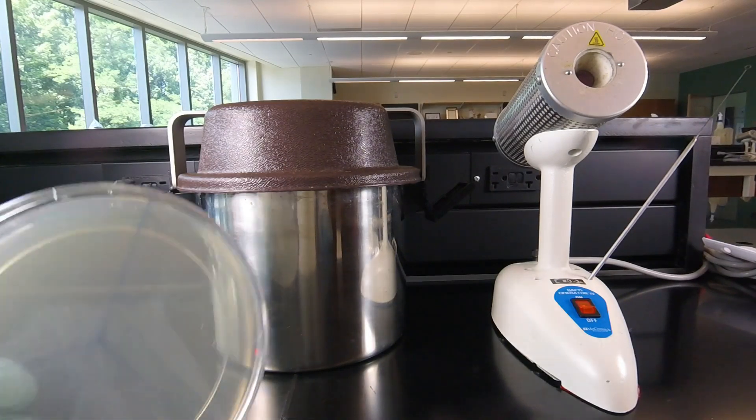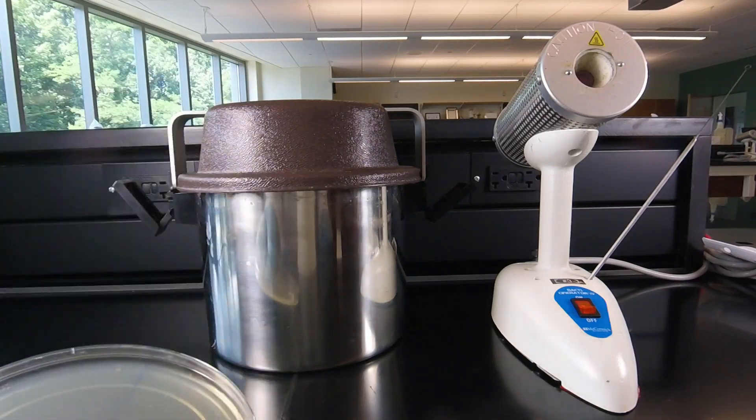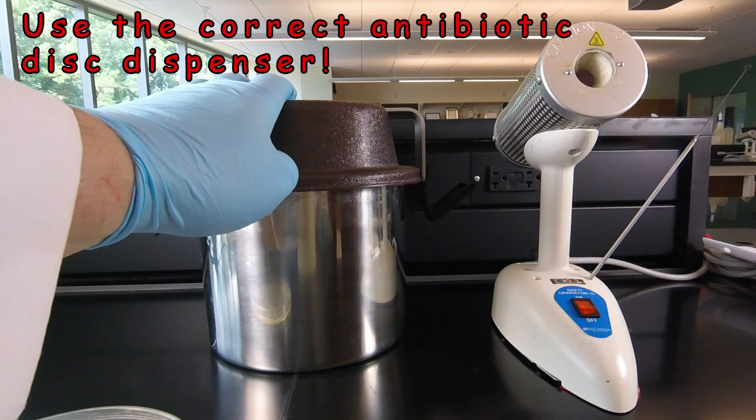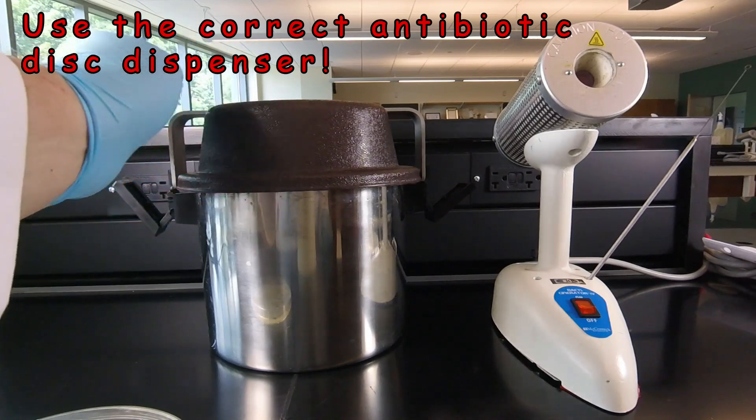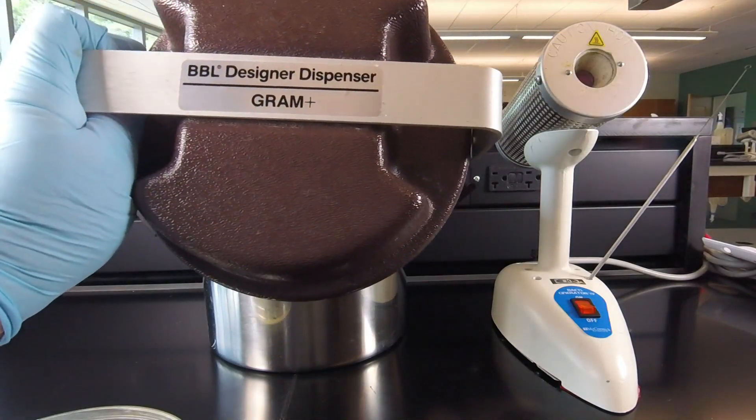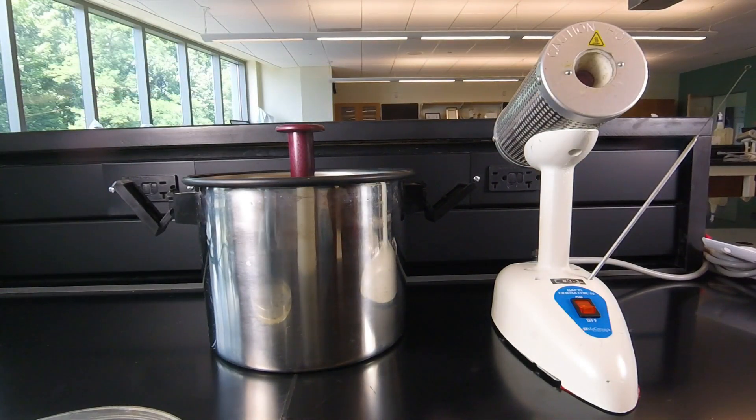Now since this is Enterococcus faecalis, a gram-positive bacterium, we're going to use the antibiotic disc dispenser that contains antibiotics often useful against gram-positive bacteria. You see that the lid is labeled gram-positive.